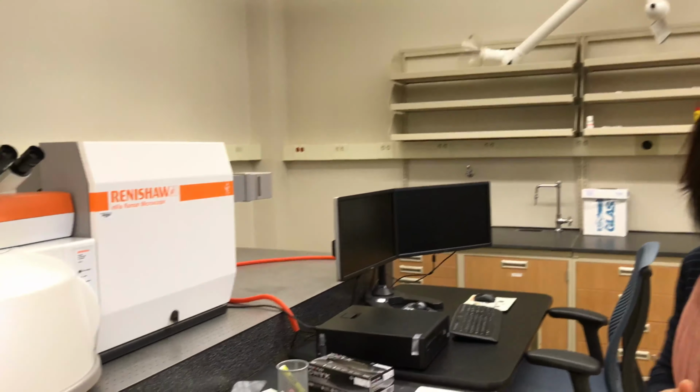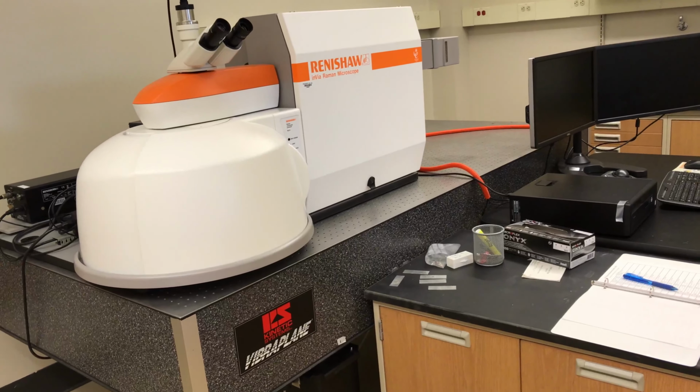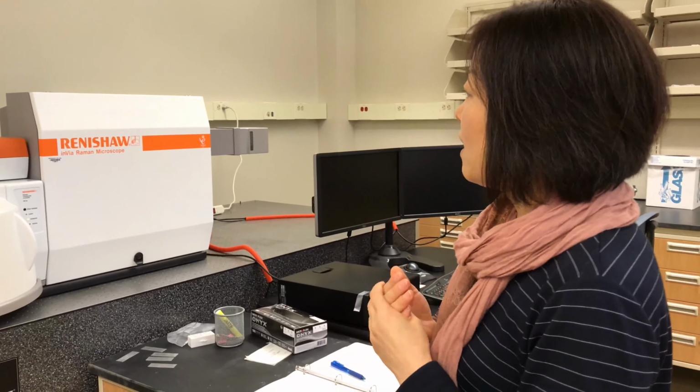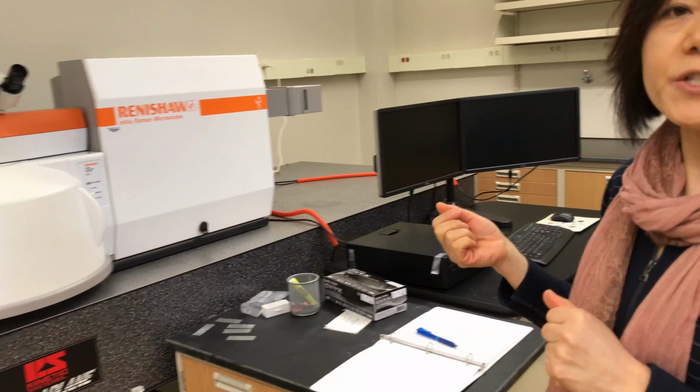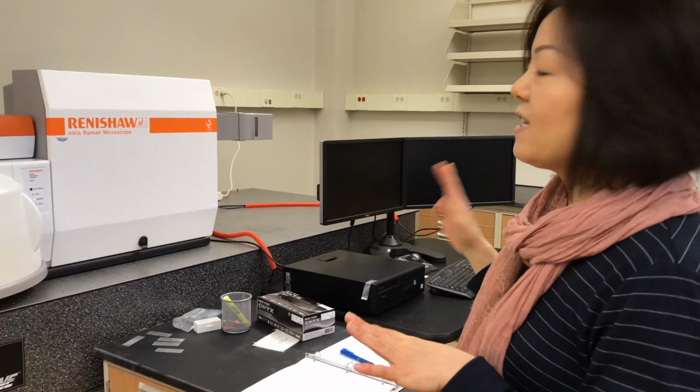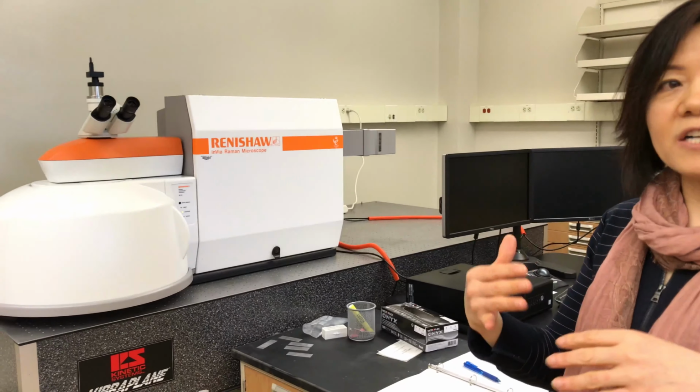Here in this room, we have 3 major pieces of equipment, and this one here is the Renishaw, that's the Raman microscope. Basically, the user checks the sample, and by checking the spectrum, it's like a fingerprint of people. Each person has their own fingerprint, and each material has its own spectrum. So we have 3 types of laser: 532, 633, and 785 nanometer. For the user to choose when you work with different material, one specific laser will work well. So you can choose that. It's pretty easy to operate, and after you get your data, you can compare with the data library and find out what type of functional group your material belongs to.